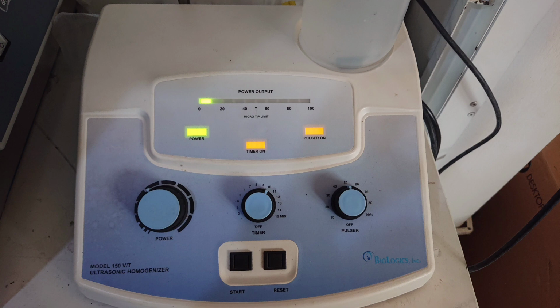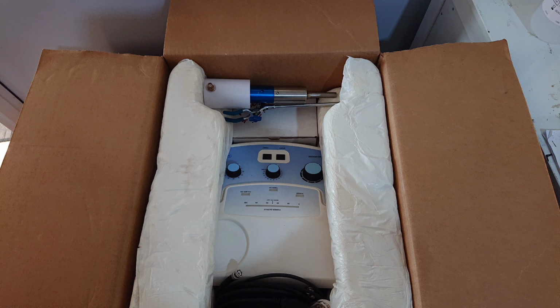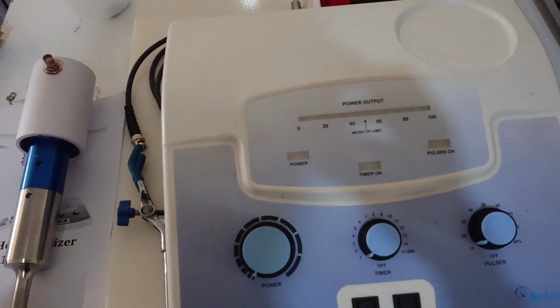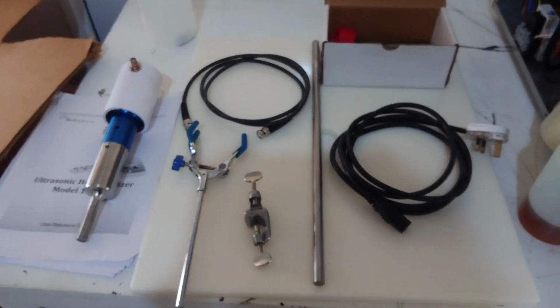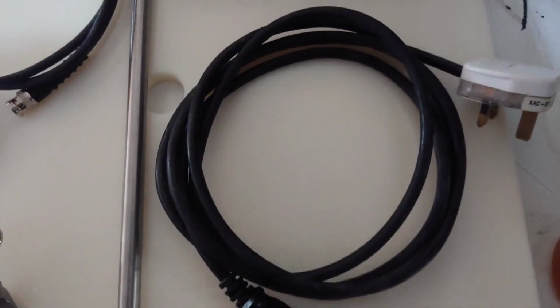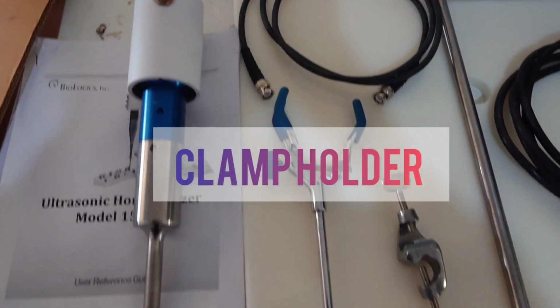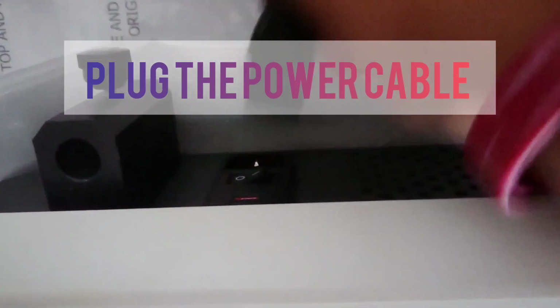How does an ultrasonic homogenizer work? The basic principle behind an ultrasonic homogenizer is the phenomenon known as cavitation. Cavitation occurs when high-frequency sound waves pass through a liquid medium, creating alternating high-pressure and low-pressure cycles. During the low-pressure cycles, tiny bubbles form and grow within the liquid. When these bubbles reach a critical size, they rapidly collapse or implode, generating intense localized energy. These implosions create shock waves and microjets, which result in the disruption and breakdown of particles within the sample.